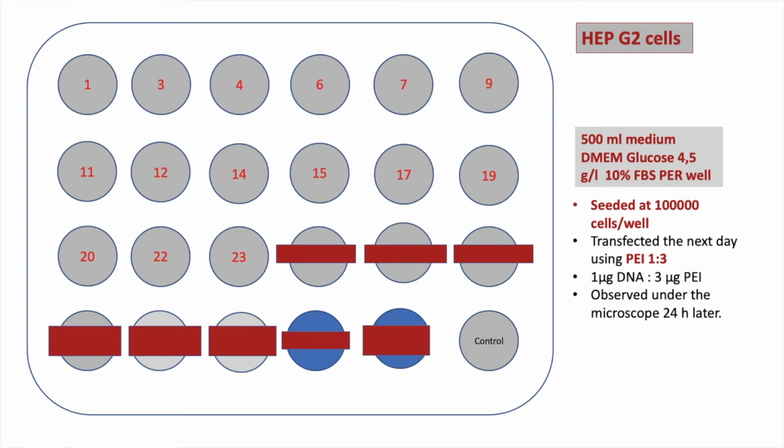So that means I used 1 microgram of DNA for every 3 micrograms of PEI. And the next day, so after about 24 hours, I observed all the wells under the microscope, both optical and fluorescent. The problem is that I did not get any green cells, so none at all. The positive control, which remember was supposed to generate fluorescence and was supposed to transfect, actually did not. I only saw like 2 or 3 green cells for the whole sample.